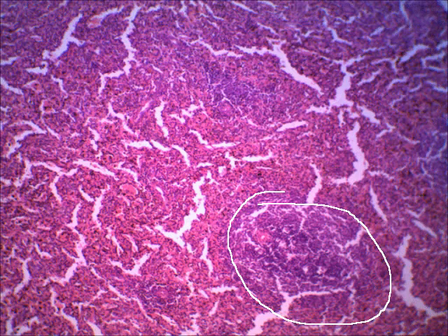We will not do the thymus gland. The two slides you need to be responsible for in this exercise are simply the lymph node, be able to recognize the lymphatic nodules and the sinuses and the capsule. And then on the spleen, all you have to do is be able to distinguish between the red pulp and the white pulp.